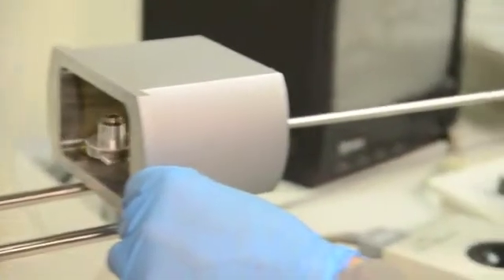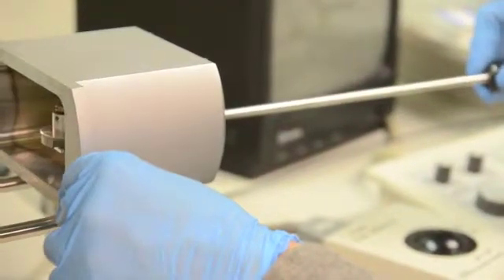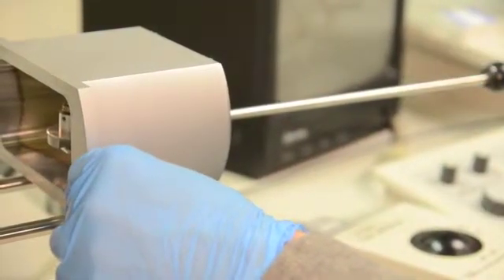Pull the rod and sample holder assembly back until it clicks into the holding position. You will hear the click.